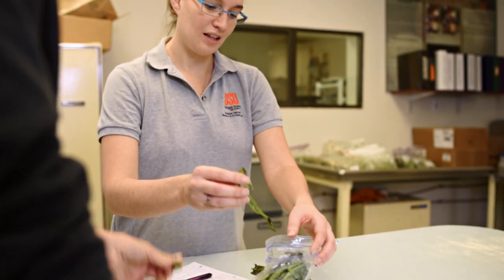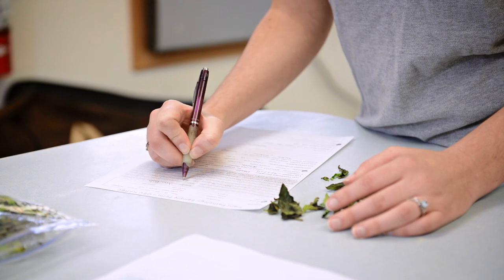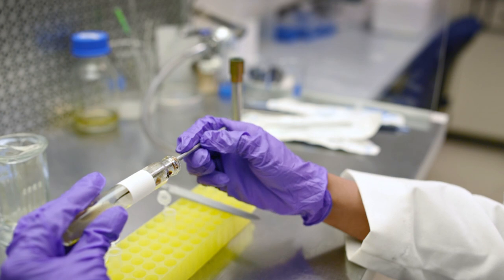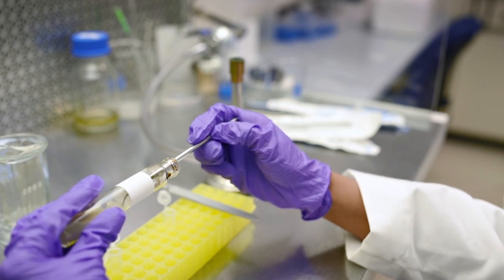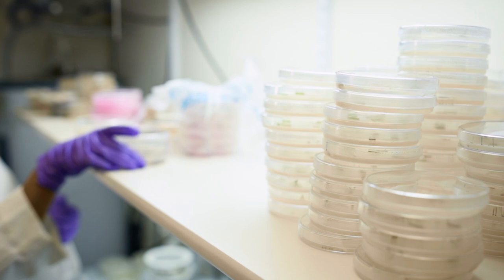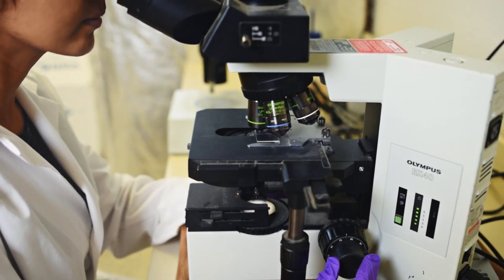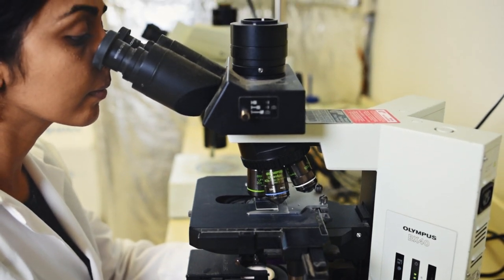After the initial examination we compile a list of possible suspects and set up the required isolation techniques and tests. For many of the fungi that come in we take lesions from different parts of the plant and plate them on the various culturing media that we have to encourage fungal growth. As the fungus grows we can identify it based on certain structural characteristics like their conidia.